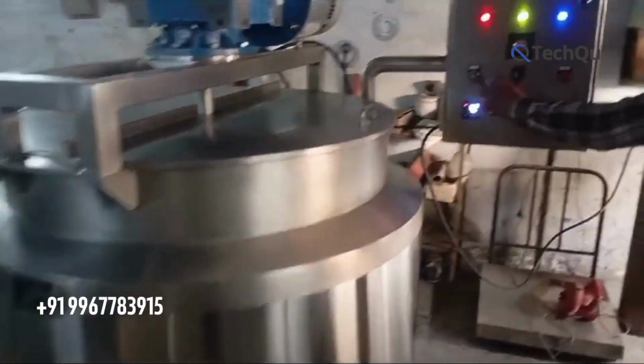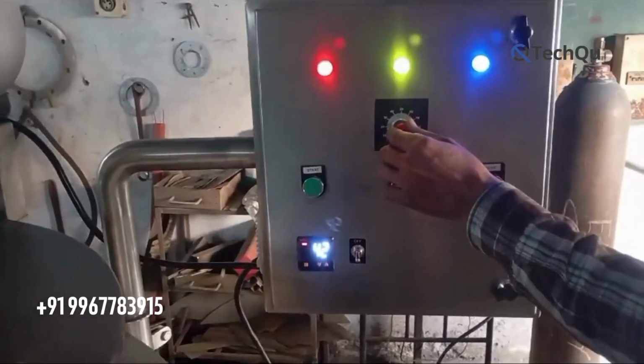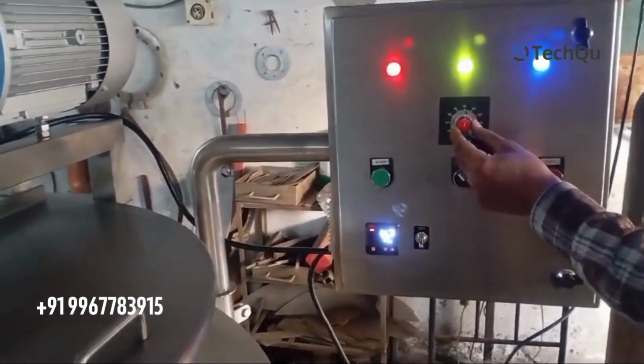Welcome to our TechQu. Today we will explain in video about ointment manufacturing vessel.